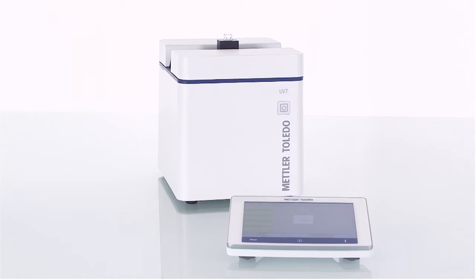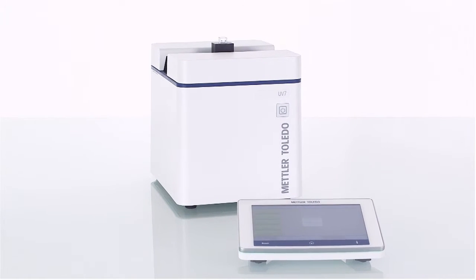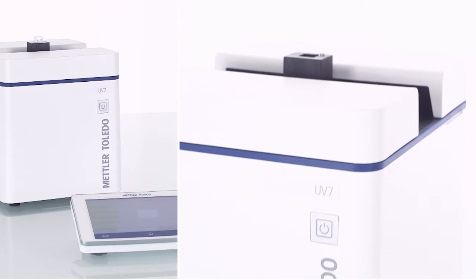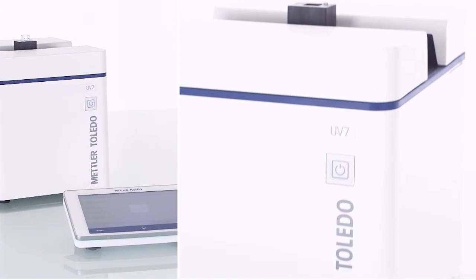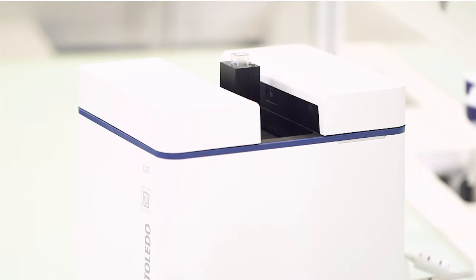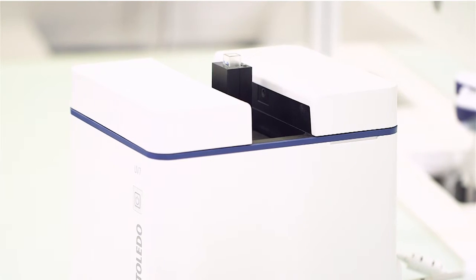The Mettler Toledo UV-7 Excellence Spectrophotometer can guide you securely through your workflow and offers user guidance for each step of your application.